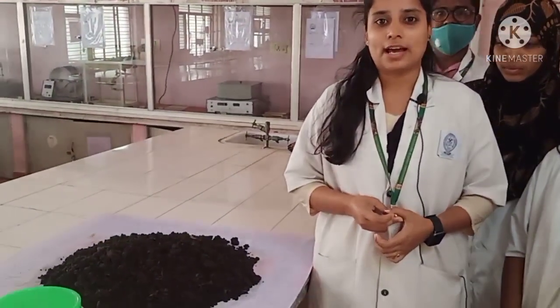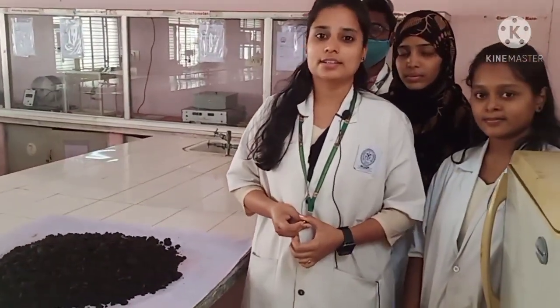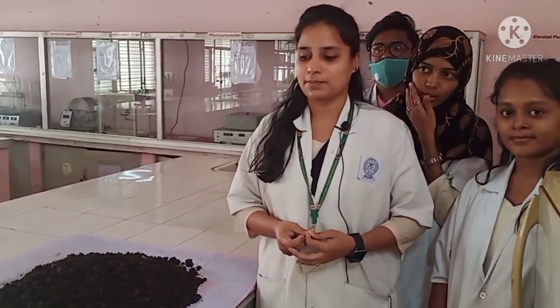Good afternoon everybody. This is Jasmine, this is Katie, this is Gulab Jan, this is Gulab. We are students of third year B Pharmacy studying at Raghavindra Institute of Pharmacy College located in Anantapur. Today we are in the pharmacology lab, doing an experiment under the guidance of Mr. A Sudhir, who is the associate professor in our pharmacy college in the pharmacology division.